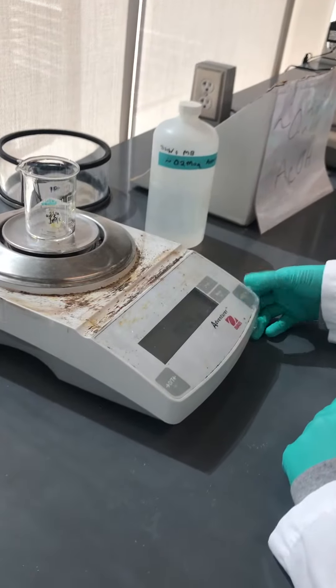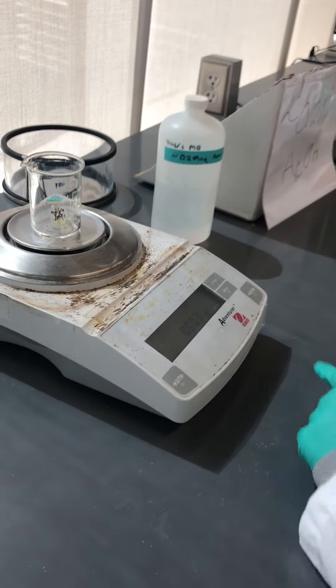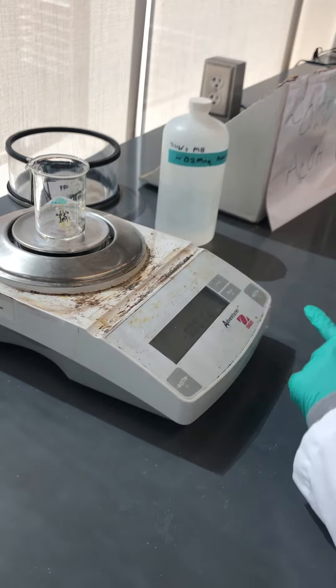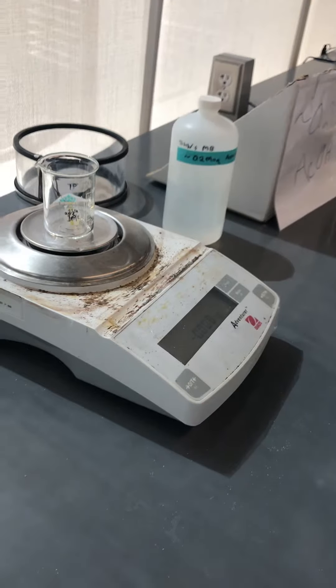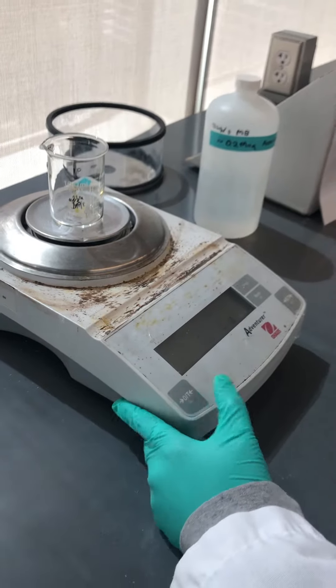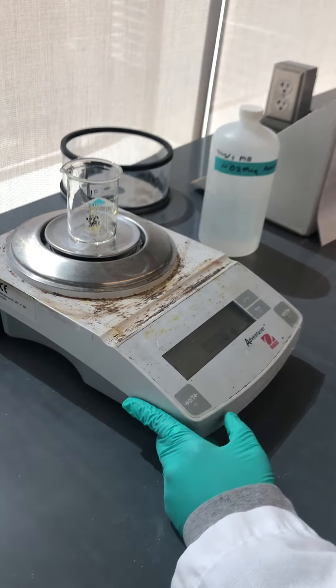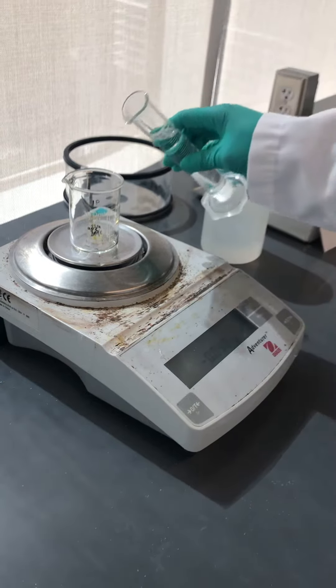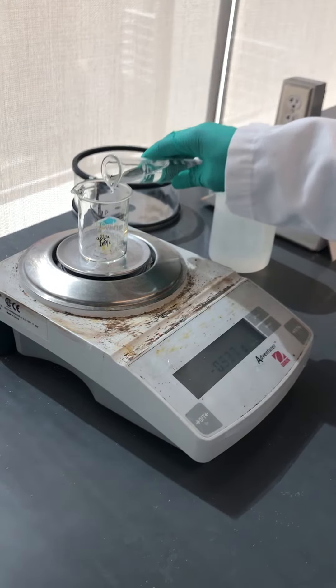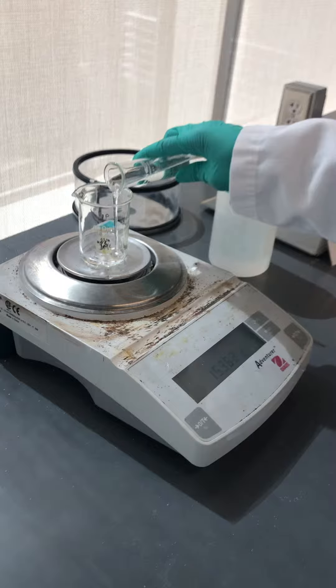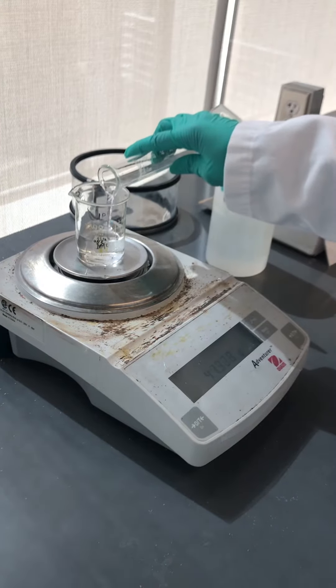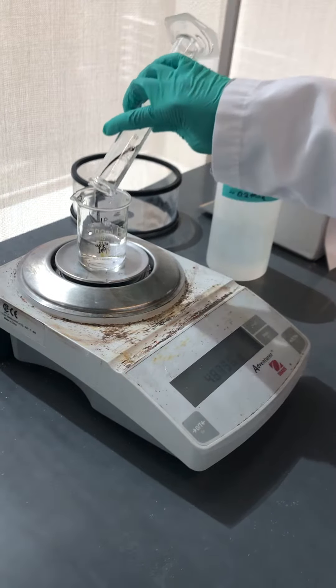Why don't you just... There it goes. All right, now we add the water. This is 50 milliliters that I had measured in a graduated cylinder.